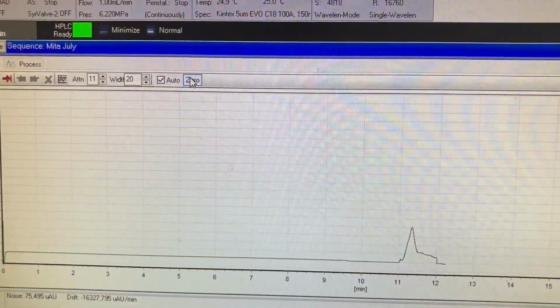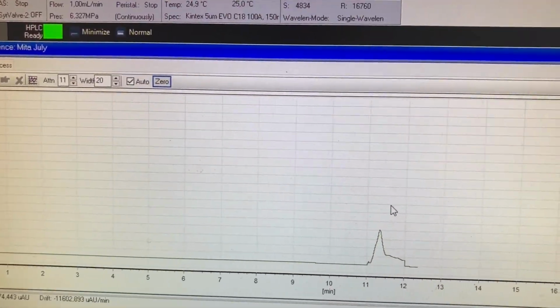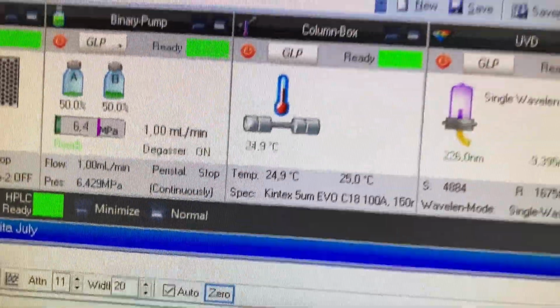So I've zeroed the graph to bring it on screen. It's looking good so far because it's actually reading something, and that ferrule hasn't blown out yet, it's not leaking yet, but the pressure's still very low.